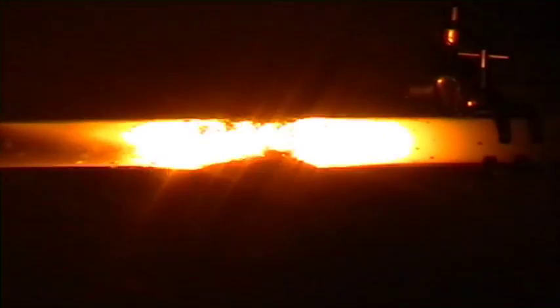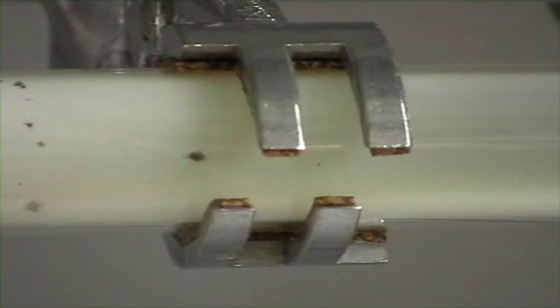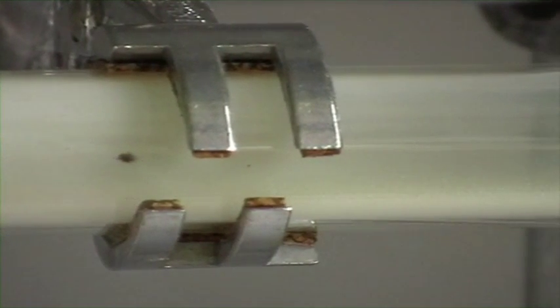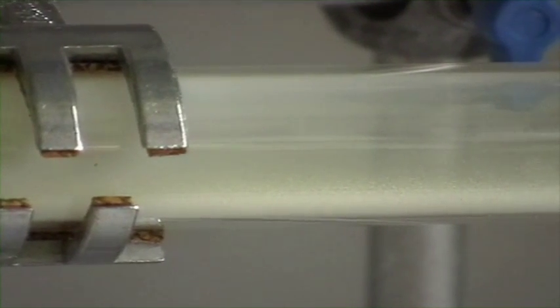It gives out a lot of energy — heat energy, light energy. The yellow colour is, of course, the yellow of sodium. And what are we getting at the end of the day? We are forming sodium chloride. You should see in a moment, when we see the tube, there's actually a lot of black around it. This is where some of the sodium has actually reacted with the glass — these metals are so reactive they react with the glass. But also we see the white colour here, and that is sodium chloride.